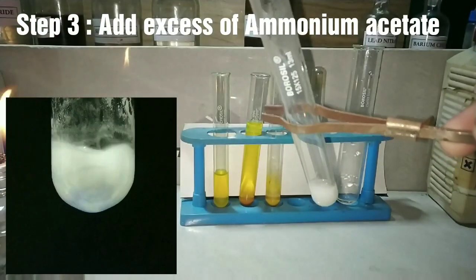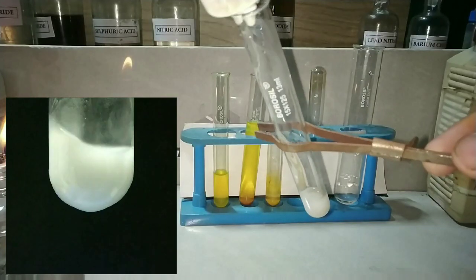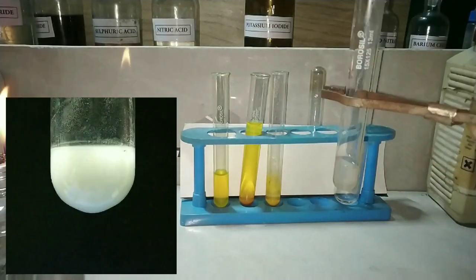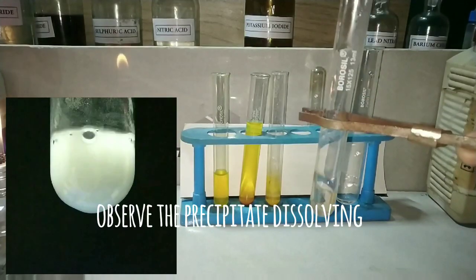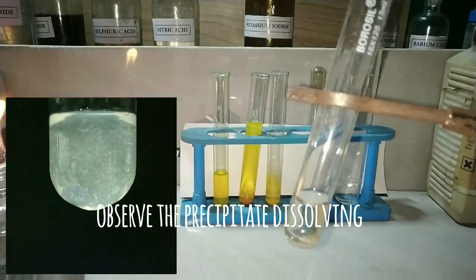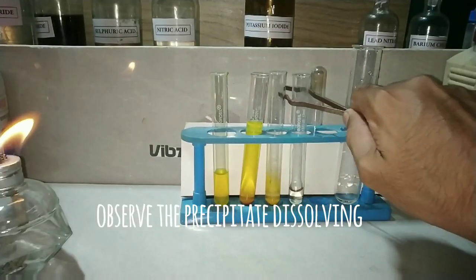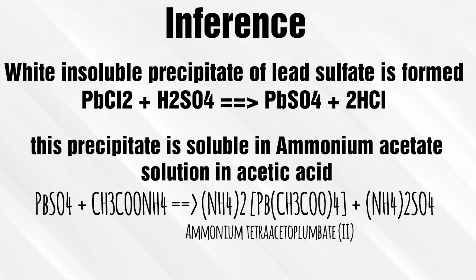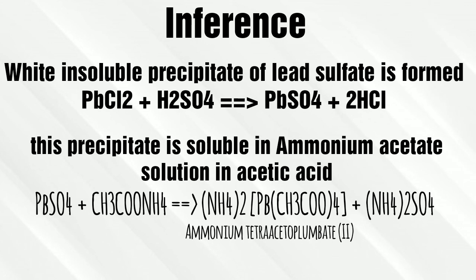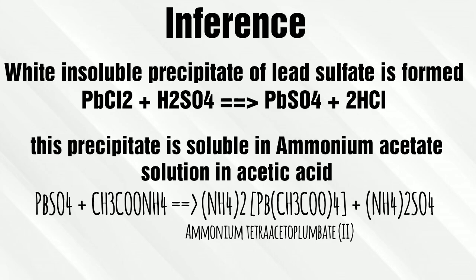Now we try to dissolve this white precipitate in excess of ammonium acetate in acetic acid solution. On adding this solution, the precipitate has started to dissolve and the solution has turned clear. The white insoluble precipitate formed was lead sulphate, which is soluble in ammonium acetate in acetic acid, forming the ammonium tetraacetoplumbate(II) complex.